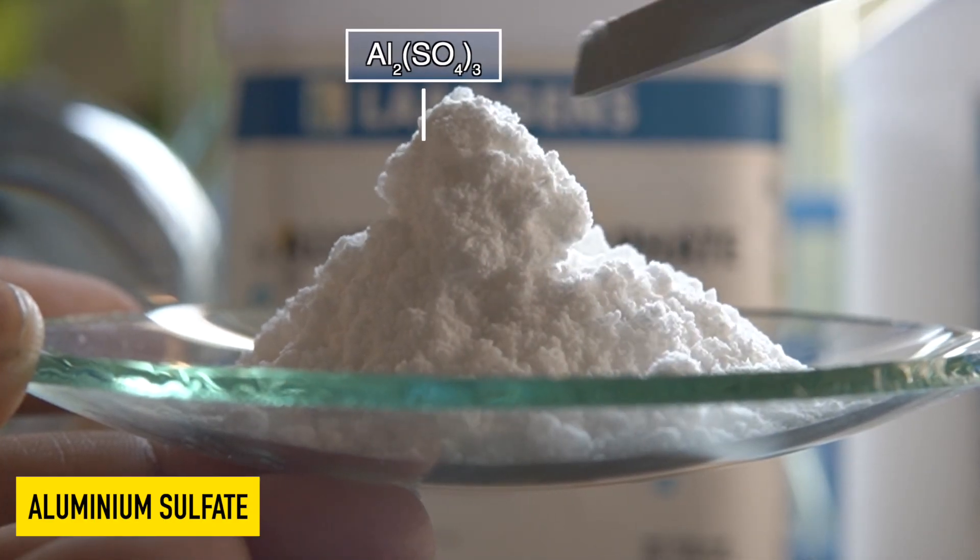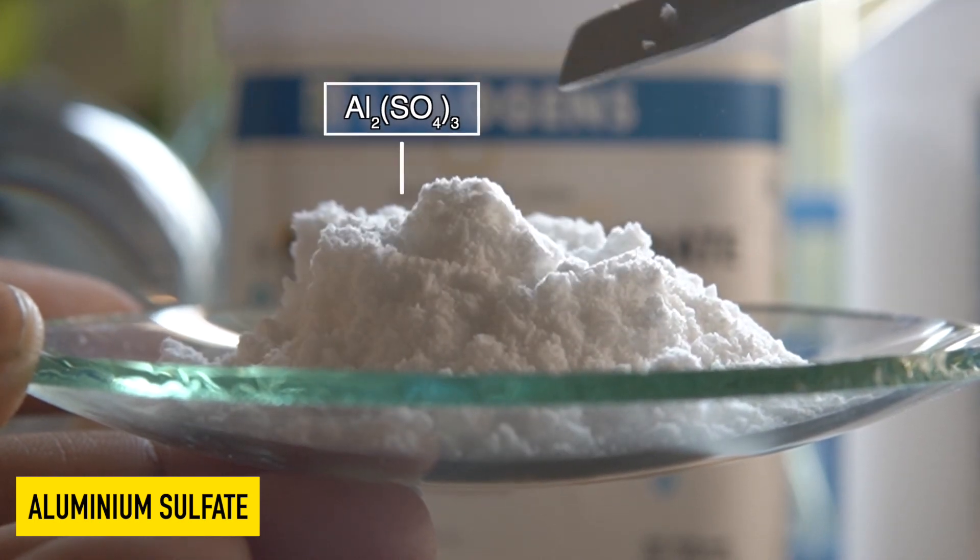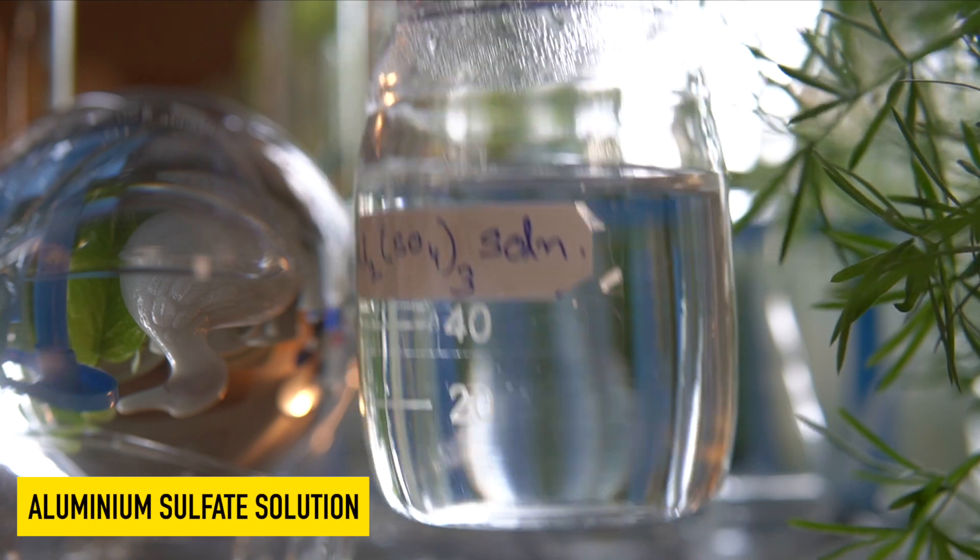This is aluminium sulphate, a white powdery substance that can dissolve in water very easily.